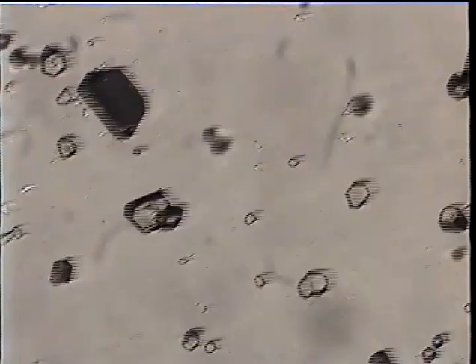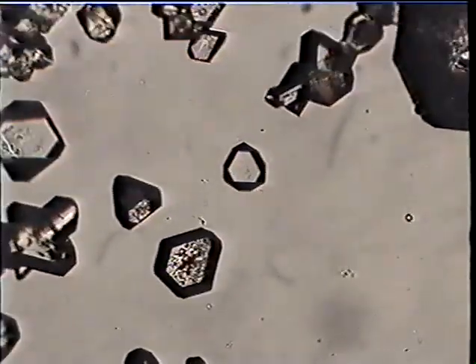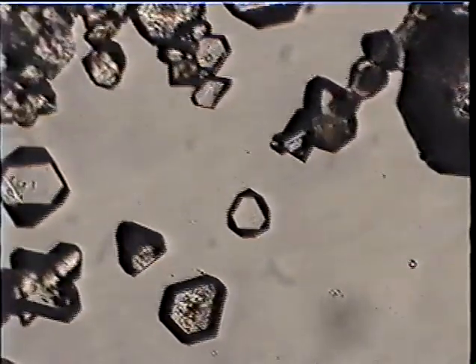But now as it cools and evaporates, the crystals of the soluble compound lead nitrate are crystallizing out, and we can see their shapes, measure their angles, and we use this as a way of getting well-formed crystals of a given compound in order to recognize it. There's a beautiful little octahedron sitting in the center of the field.